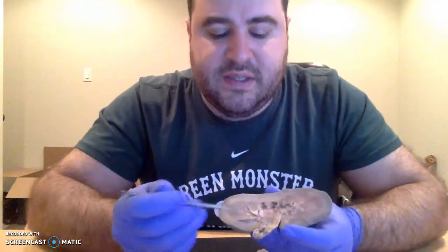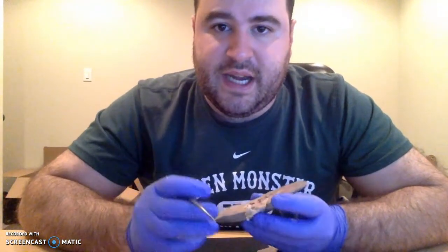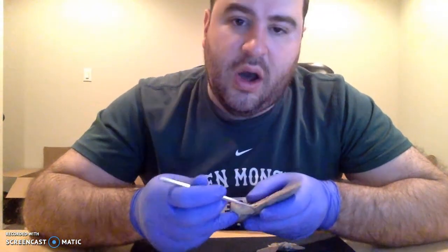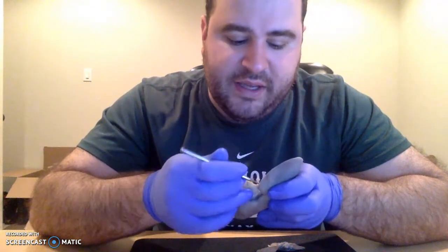These white pieces, you can see this little white bit of tissue, that's actually fat, and that fat is lining the renal sinus. The kidney's actually kind of hollow. From the hilum, it proceeds to form this little internal cavity, and the fat likes to fill that up.